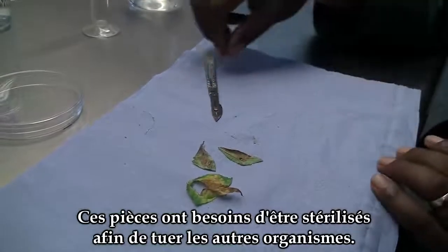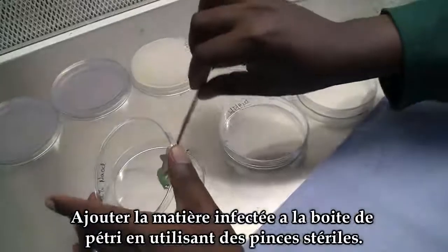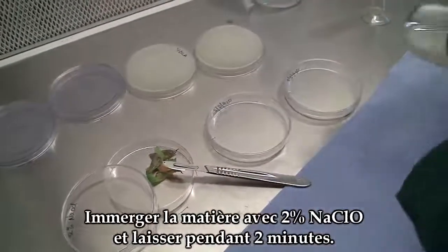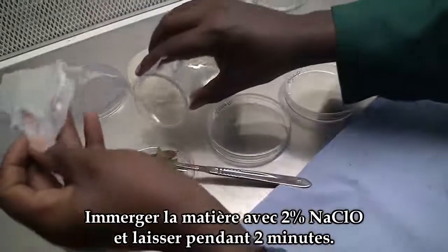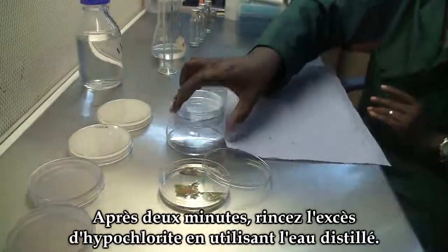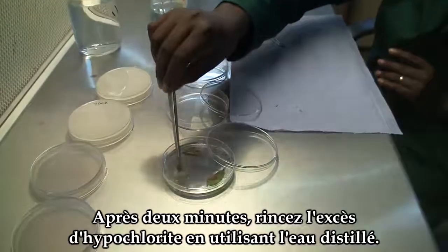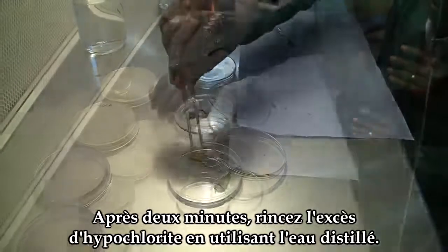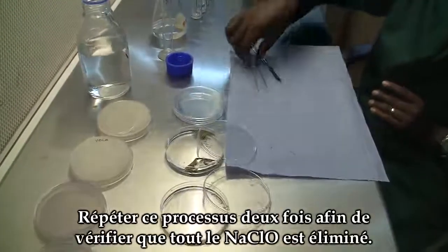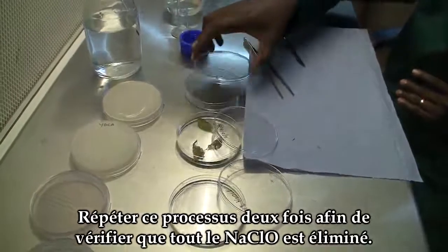These pieces will need to be sterilized to kill any other organisms. To sterilize the leaf material, you will need 2% hypochlorite. After 2 minutes, rinse off the excess hypochlorite using distilled water. This process should be repeated twice to ensure no excess hypochlorite is carried on the leaf material.